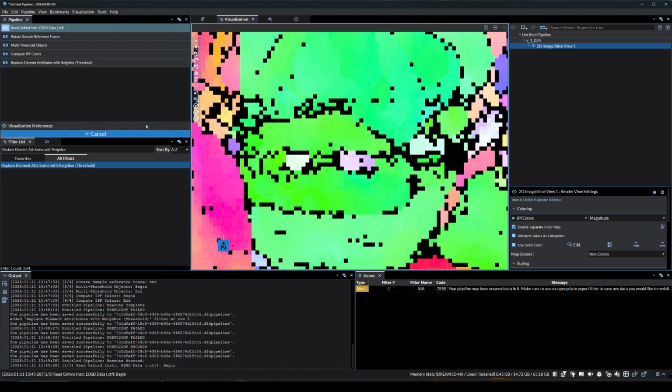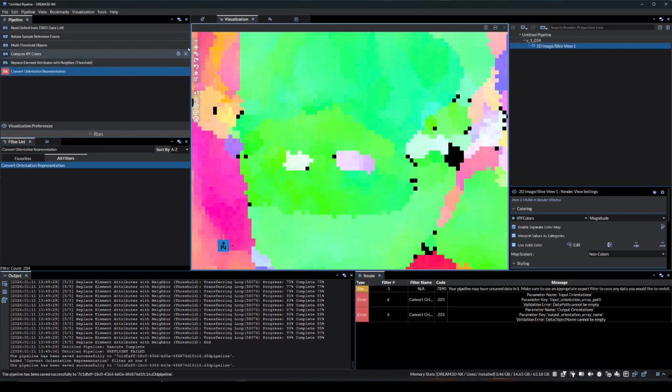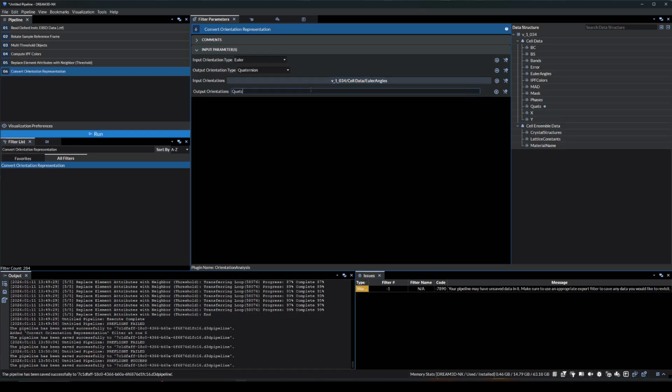Now let's run this pipeline again with the newly added filters and view the changes. We have removed the isolated, unindexed pixels. Now we'll need a Convert Orientation Representation filter. We'll need to change the output orientation type to quaternions and fill in the input path. We'll also name our output orientation quats.